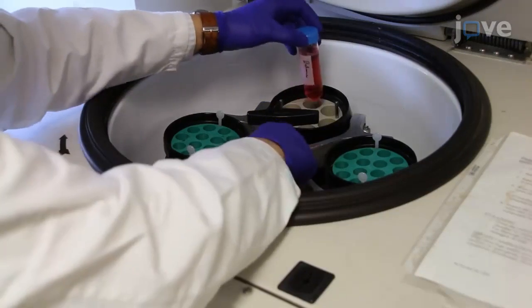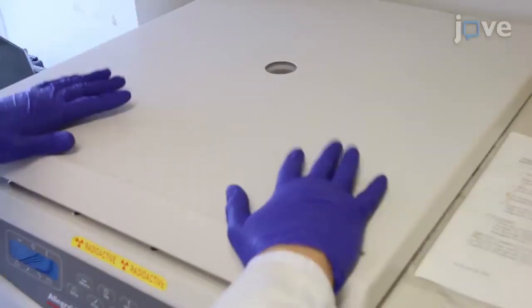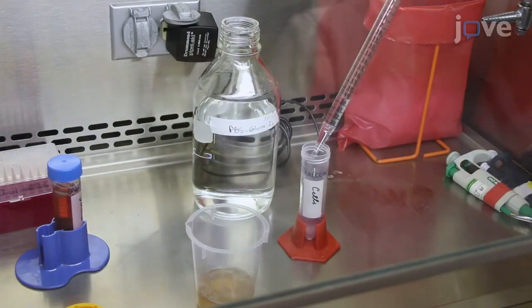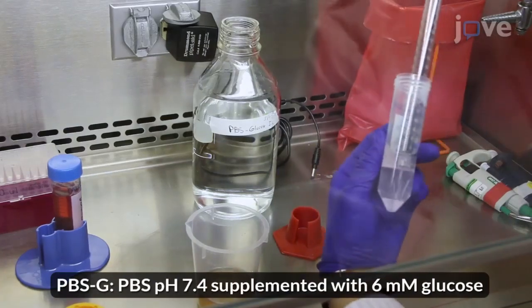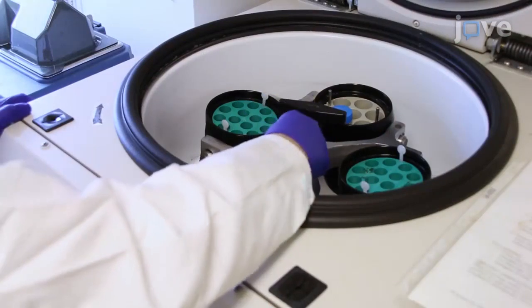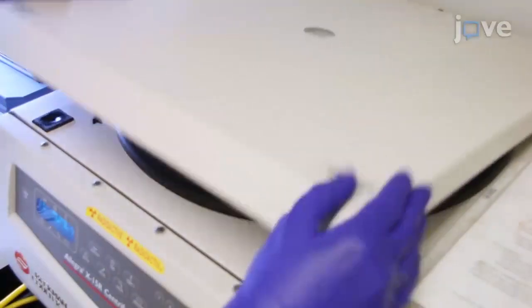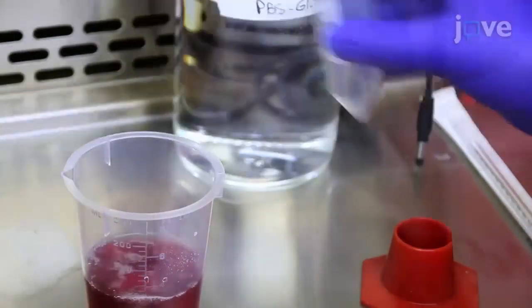When ready, centrifuge the cells at 1600 times G and at room temperature for 10 minutes. Discard the supernatant and gently resuspend the pellet in 10 milliliters of PBSG, preheated at 37 degrees Celsius, to wash the cells. Centrifuge the cells at 1600 times G and at room temperature for 5 minutes to complete the wash. Repeat this washing procedure twice more.